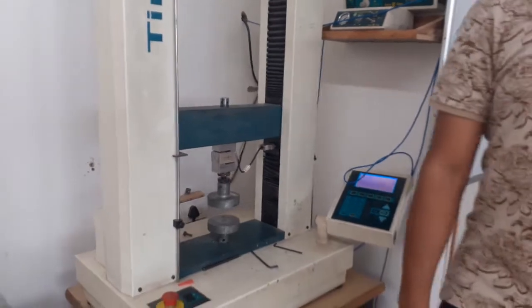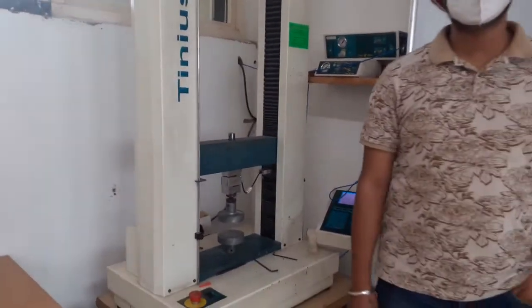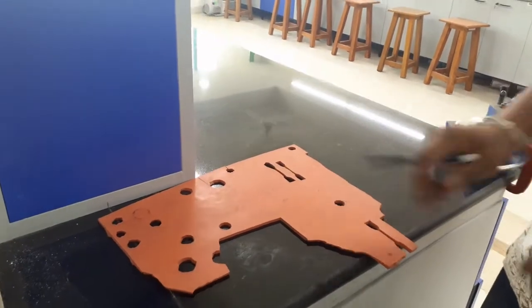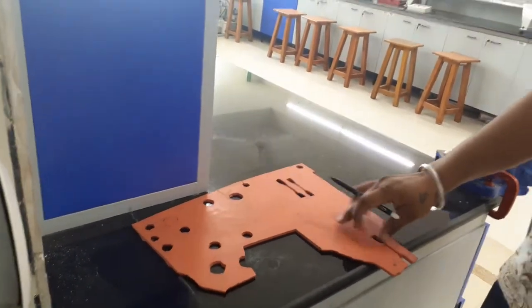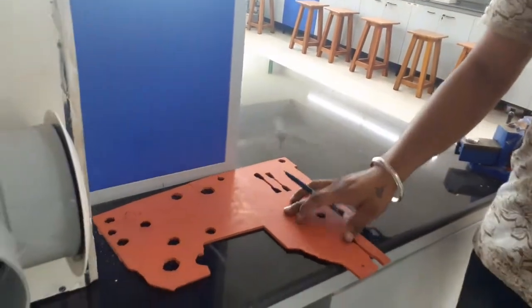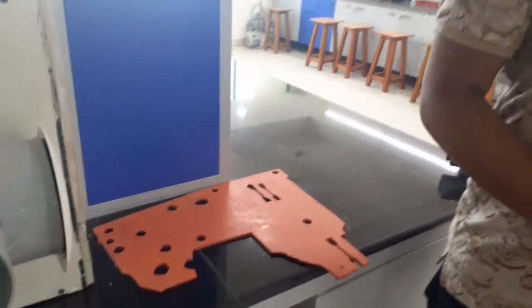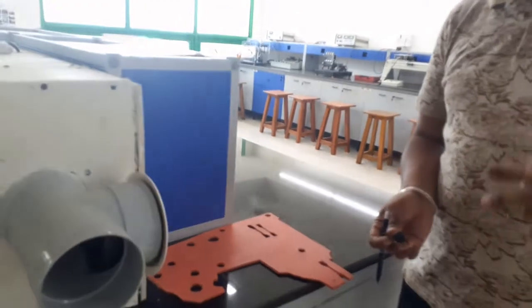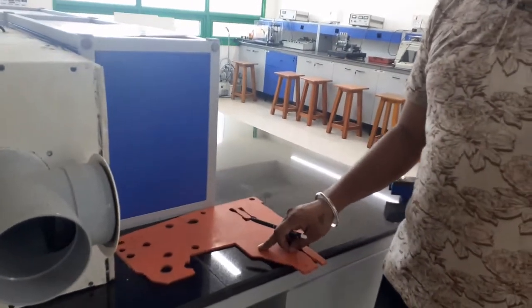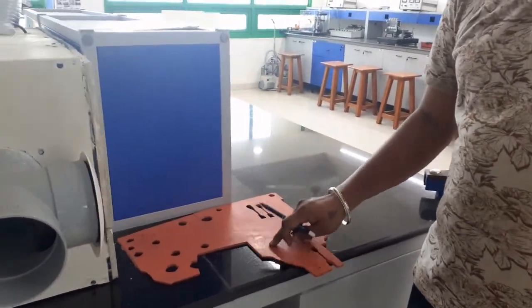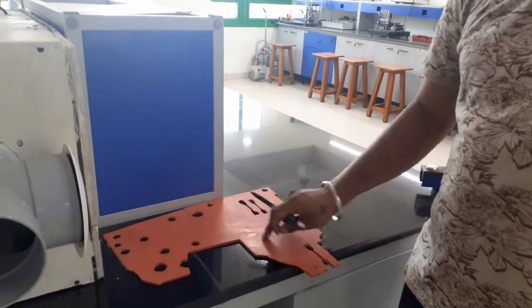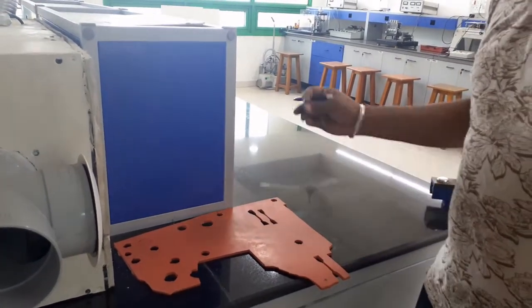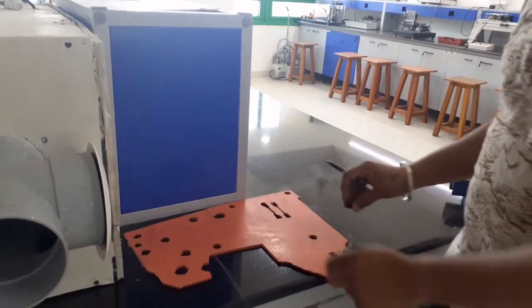We have silicon rubber, this is our silicon sheet. From this sheet we cut our sample. For the compression test, the sample width and depth for the round sample need to be equal. This is a 4 mm sheet and we cut a 4 mm diameter round sample. Now let's start making the sample.